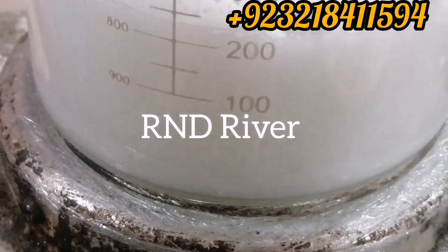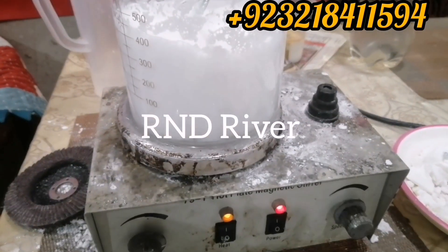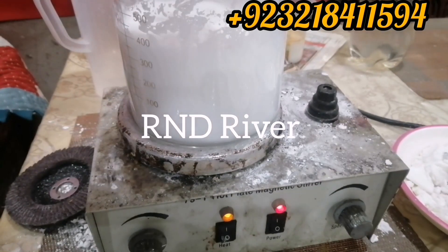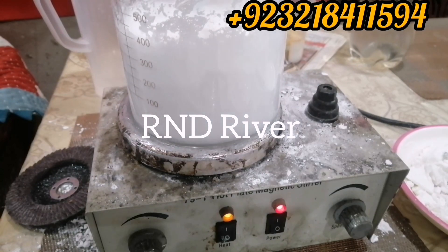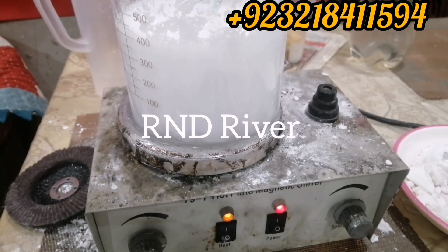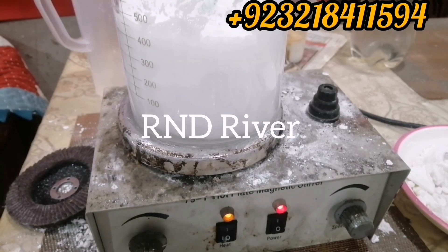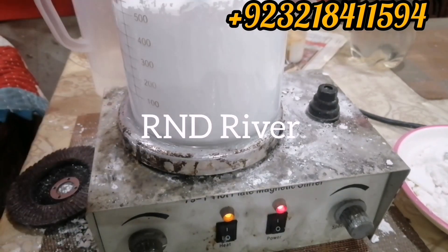Look at the bottom of the beaker. As I told in my different videos, all stearates are not water soluble. So as the reaction goes to completion, the product you are manufacturing will be on the upper side of the water, and the water will be down and separate.